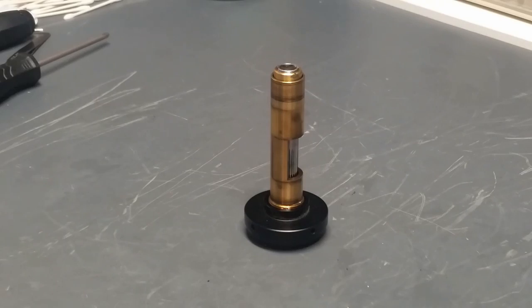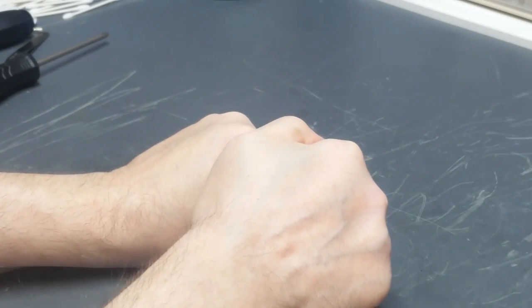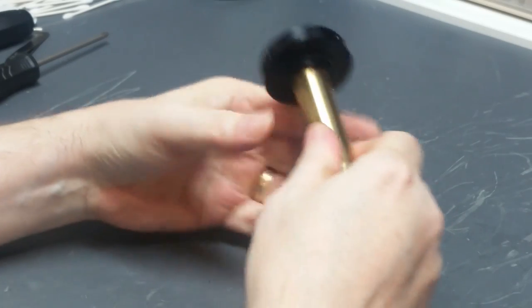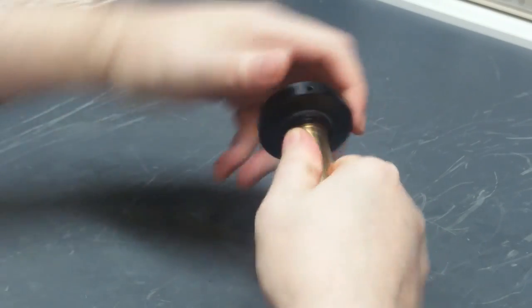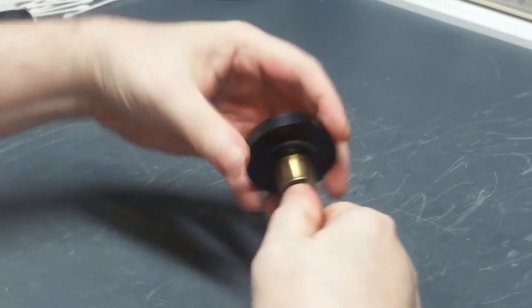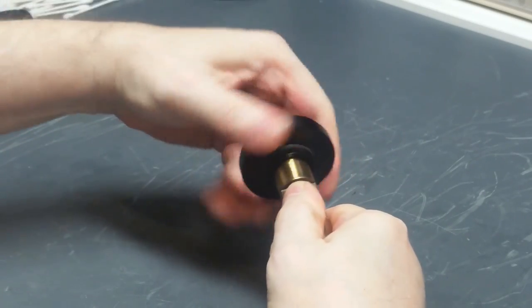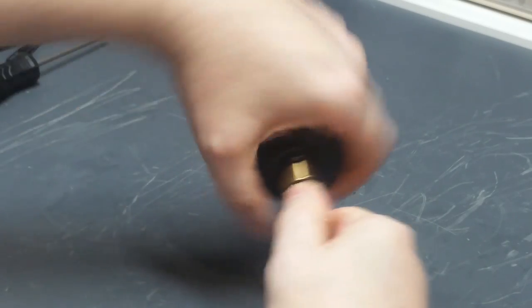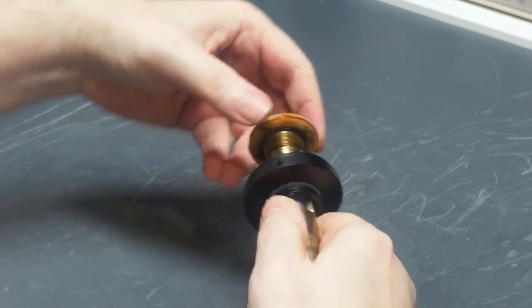Okay, that's soaked for about a half an hour, so I'm ready to give it a shot, see if I can loosen this up. Ah, she is turning. Very stiff, but it's turning. Okay, so now I want to back this off. It's left-hand thread, so I have to go the other way. Keep turning until the threads disengage, which takes a while. All right.